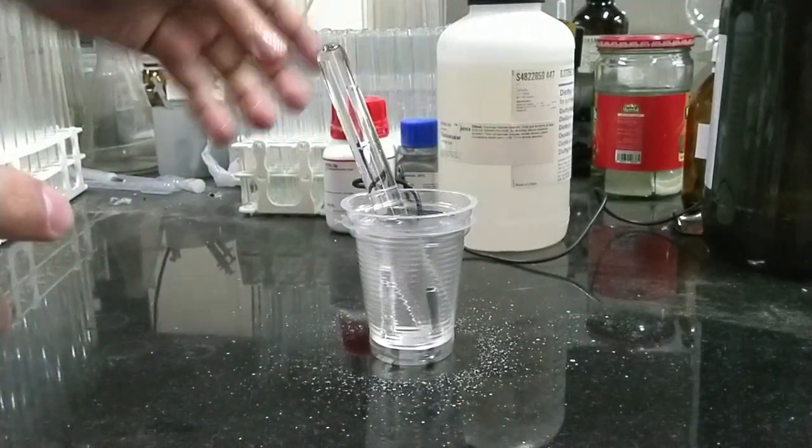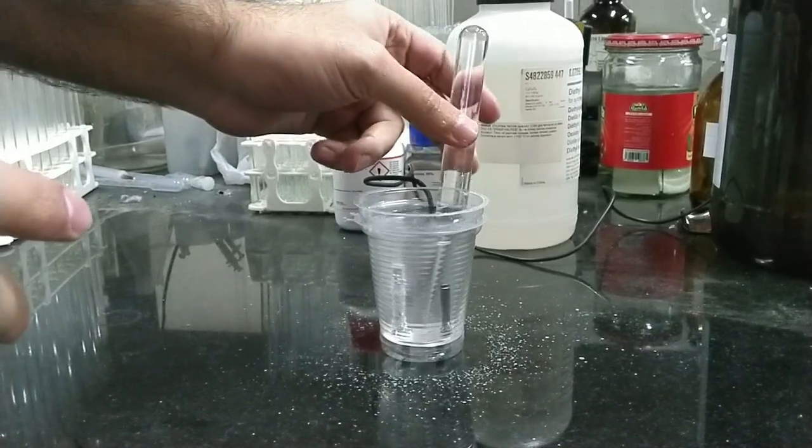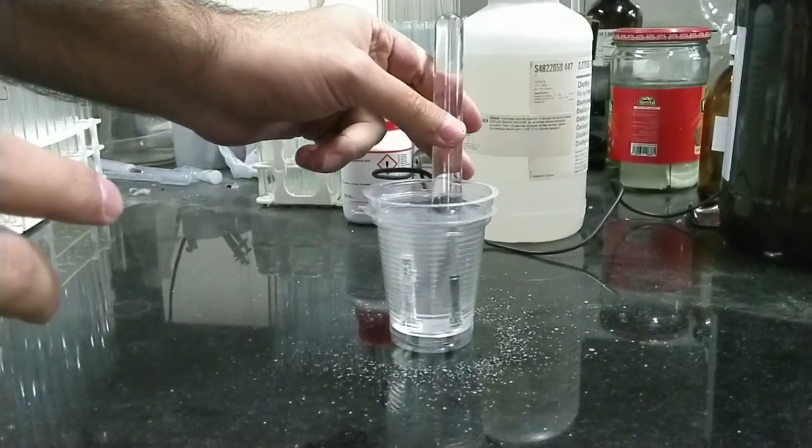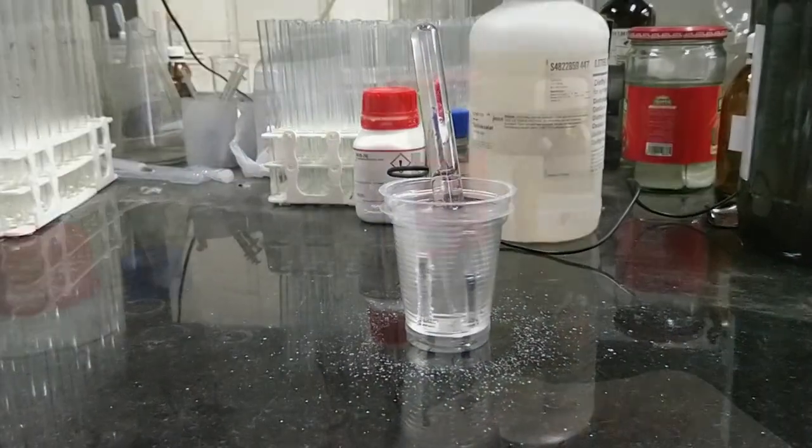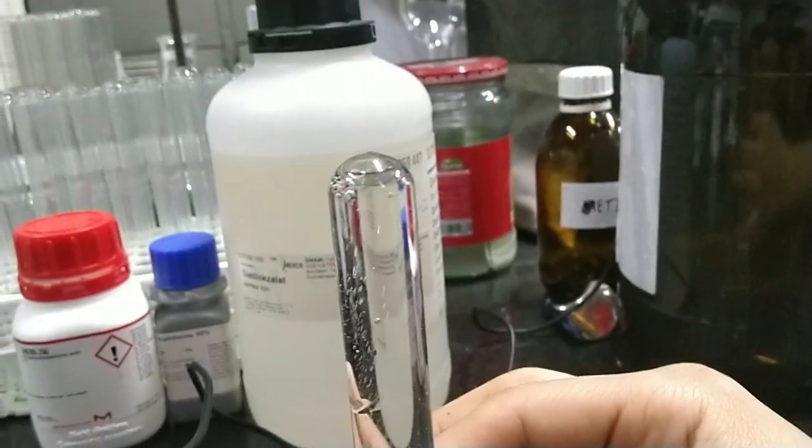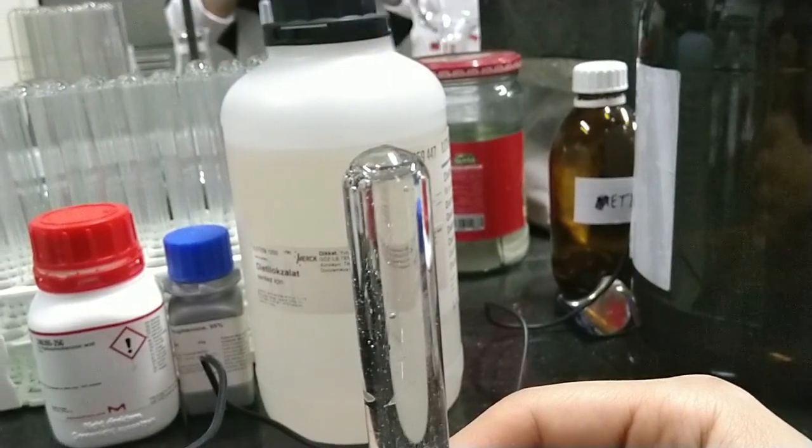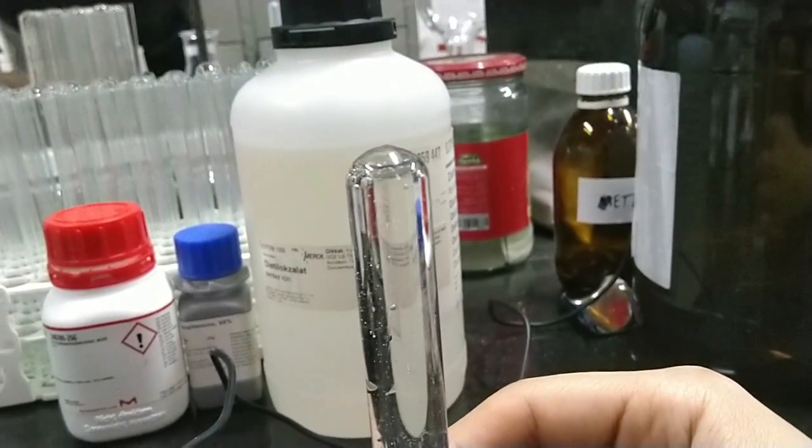As you see here I put it on the anode to collect the chlorine gas. The chlorine gas is gathering in the test tube.